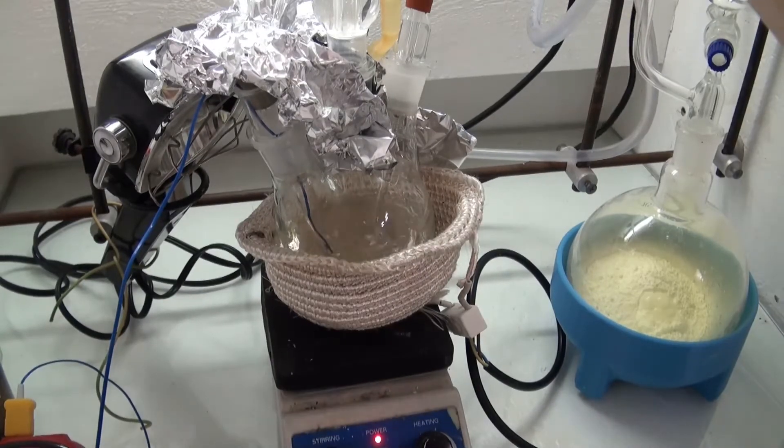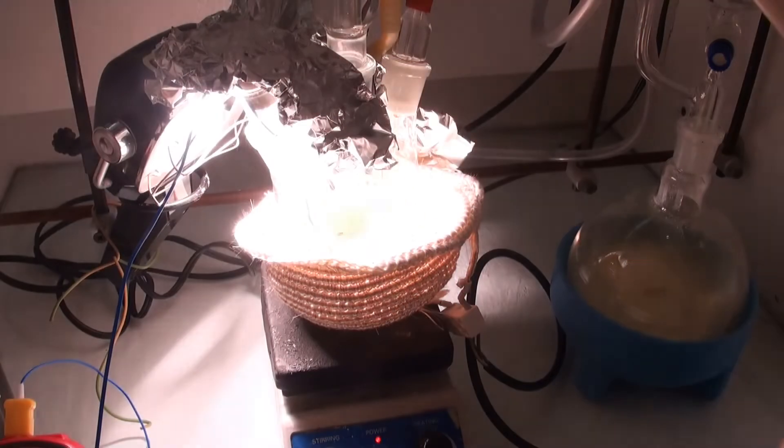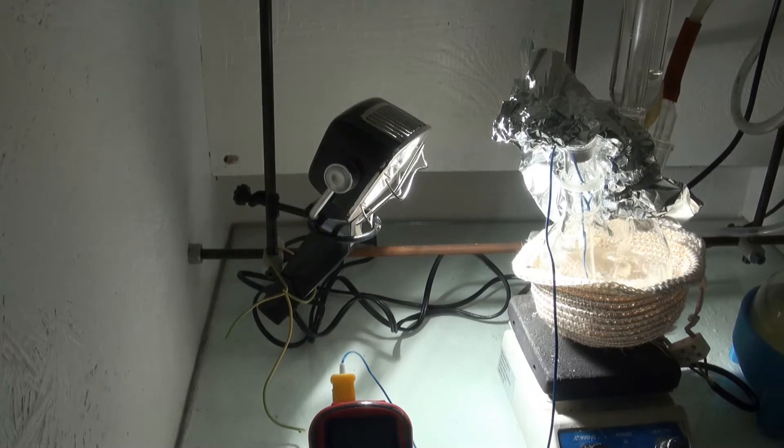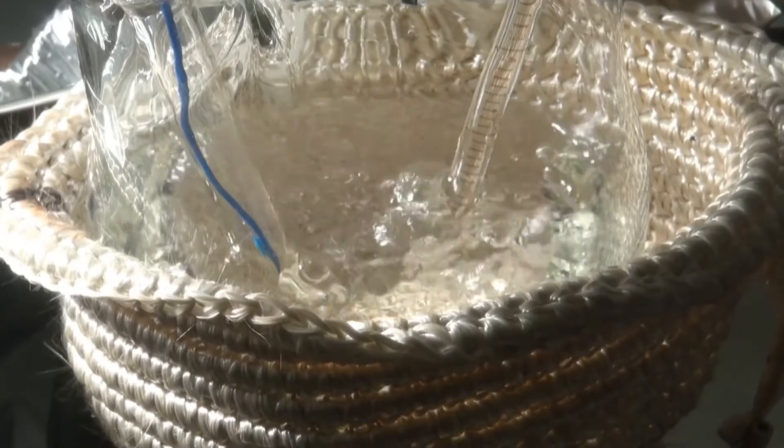Because of the immense amount of heat created by the tanning light, it started to boil uncontrollably and the toluene began to overflow the condenser. The heating mantle was turned off and more distance was placed between the reaction flask and tanning light. After this the chlorination was continued.